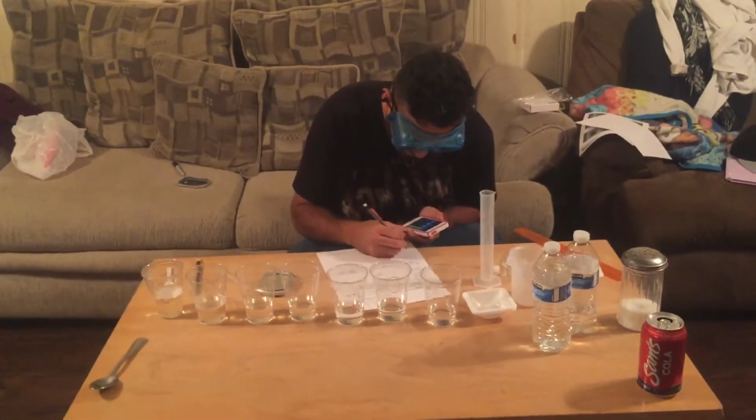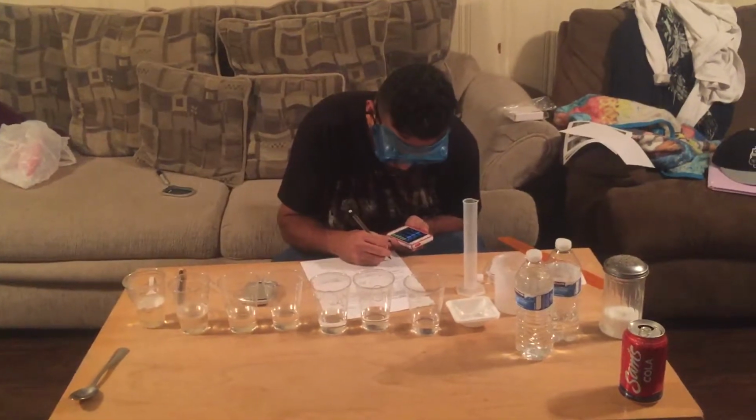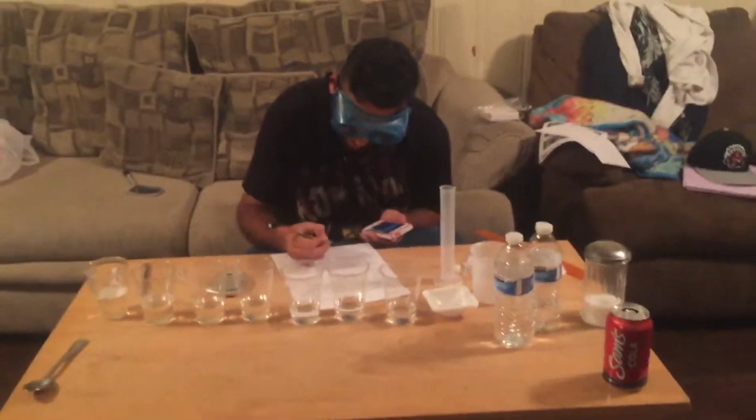For the volume, for the aluminum, I got 0.5306. So now I'm gonna do the one for the acrylic.